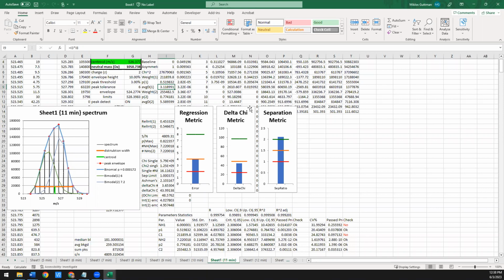The delta chi metric looks at how much the signal or the fit improved using 2 versus 1 binomial. So it's very similar to this p-value, but it's useful in that you also have these thresholds of significance that you can use to assess how good the fitting is. And lastly, the separation metric looks at how far apart these two populations are in terms of their deuteration levels.